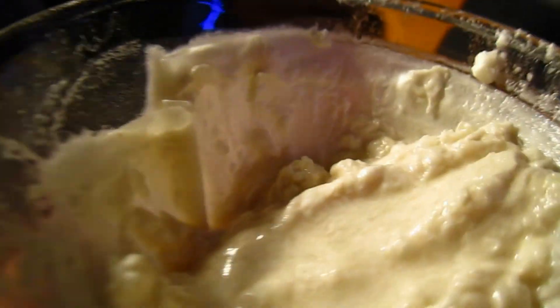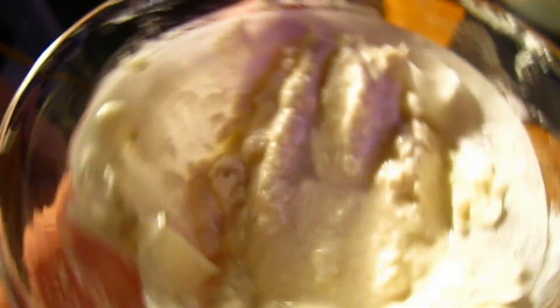So yeah, that's how our product looks after washing with cold water. I'm going to dry it and wait to see how much we lost in the recrystallization.